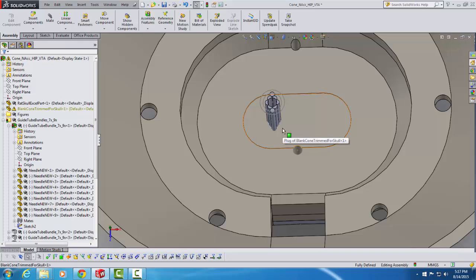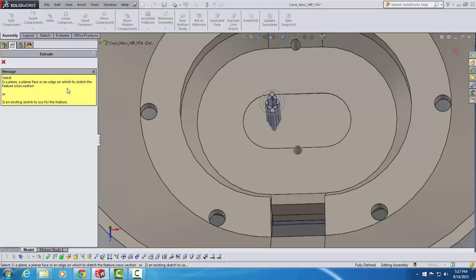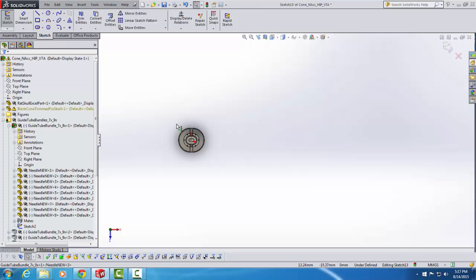In order to drill the hole that I want to drill, I'm going to go up here to Assembly Features, and I'm going to choose Extruded Cut. When I do that, I'm prompted on the left to choose a plane in which to draw the circle that I'm going to base my hole on. I'll zoom in a little bit to select it. The plane that I want is the plane that is parallel to the tops of these guide tube bundles.